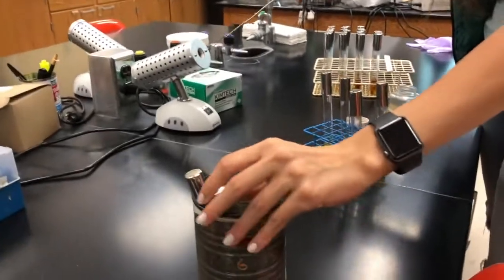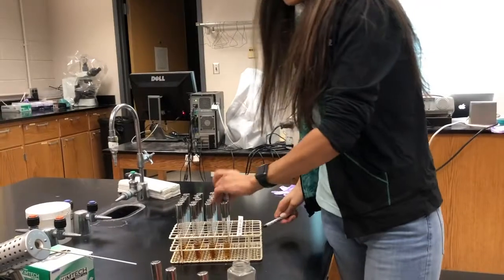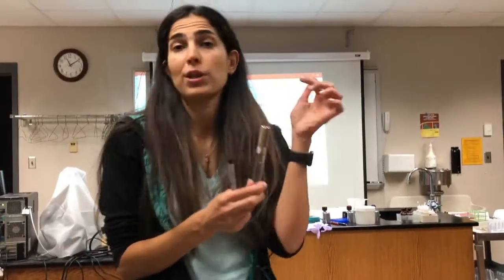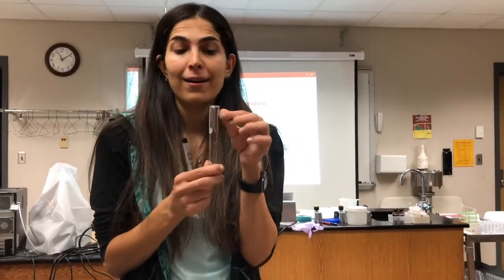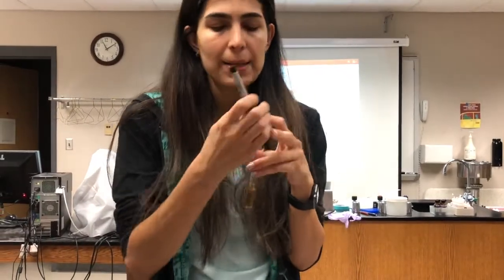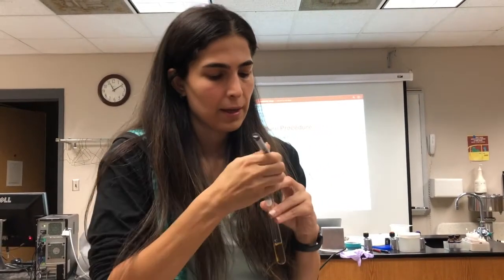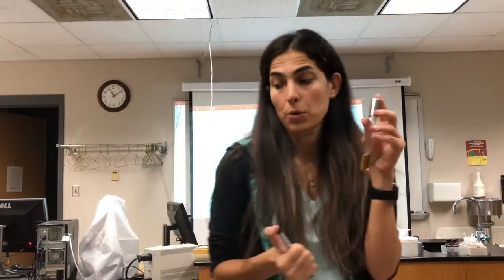Okay. Our last sample is sham, which is the negative control. Typically, we shouldn't do anything for sham. We shouldn't even open the cap. Otherwise, maybe contamination happens. We wanted to keep it super clean and sterilized. Here is the sham. We wanted to make sure that our experiment goes well. This is the reason why we use the negative control.